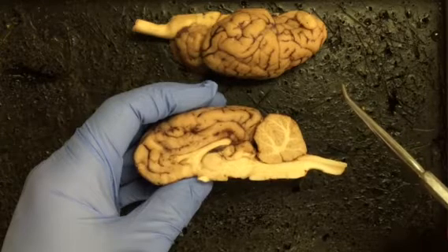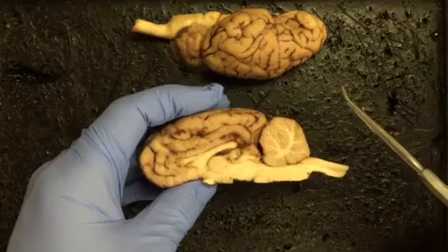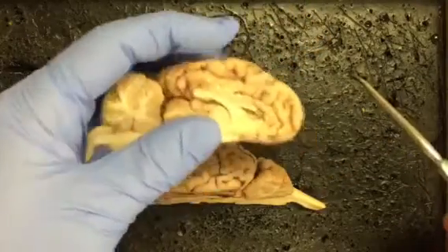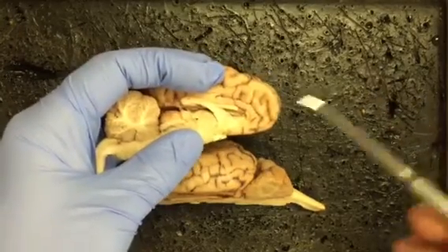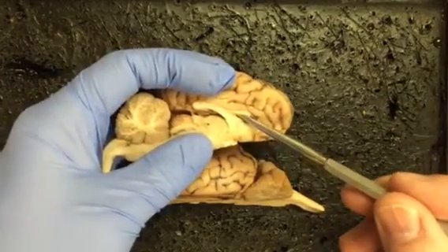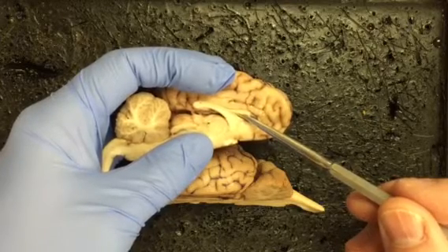Now you might recall that there are 4 ventricles total. The lateral ventricles would constitute the first and the second, but there really would be kind of an arbitrary numbering if we just said one side would be first and one side would be second. So as I put my probe down into this space, I'm actually going into one of the 2 lateral ventricles.